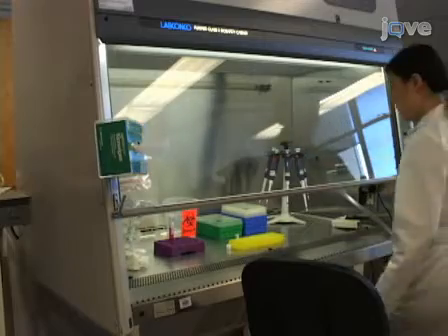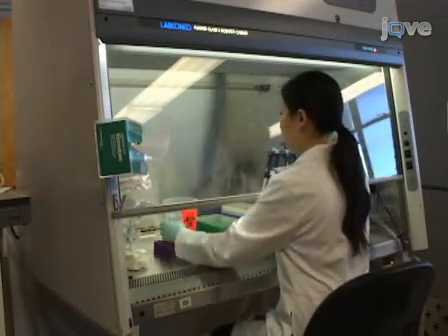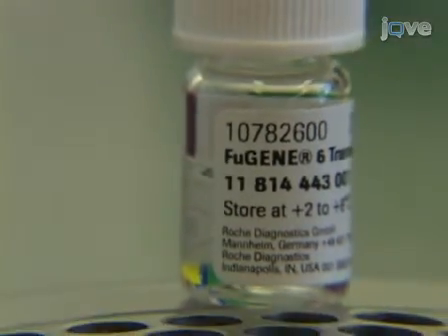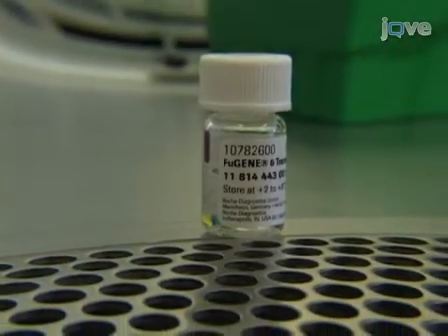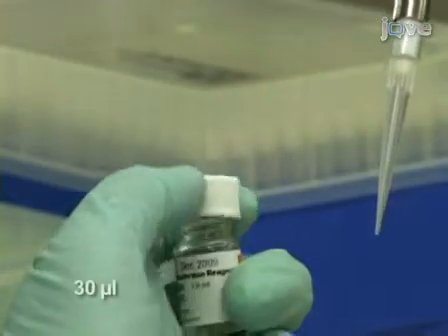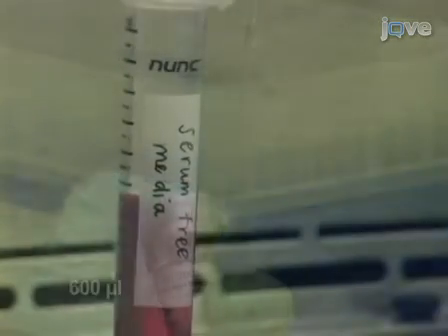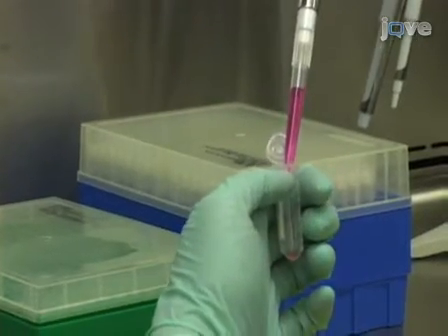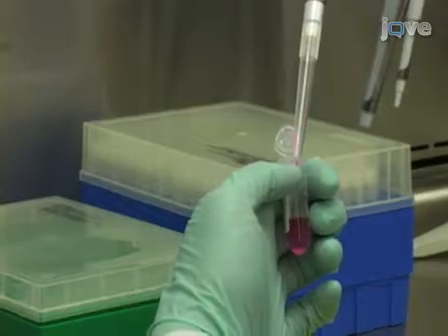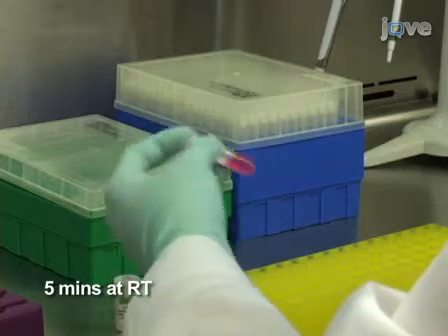To begin this protocol, prepare the DNA with which to transfect the 293T cells. First, dilute Fugene 6 transfection reagent in a 1.5 milliliter tube by mixing 30 microliters of Fugene 6 with 600 microliters of serum-free medium. Be careful not to let Fugene touch the side of the tube as you deliver it into the medium. Incubate at room temperature for five minutes.